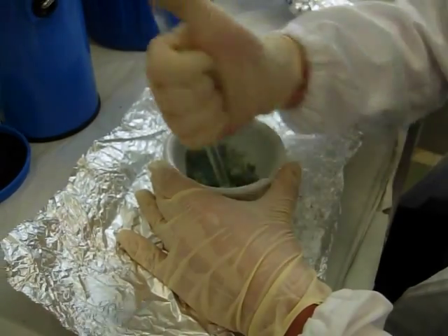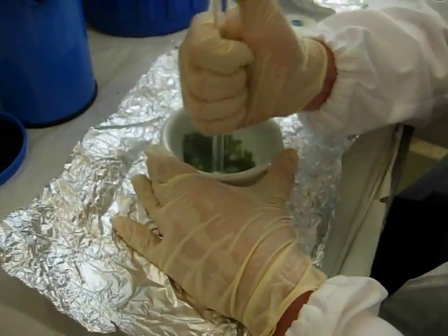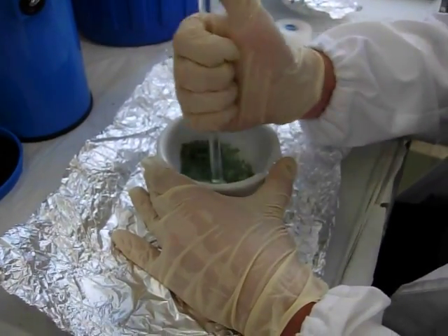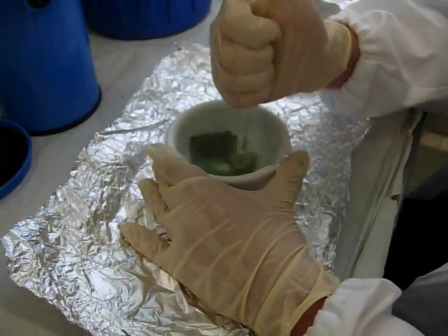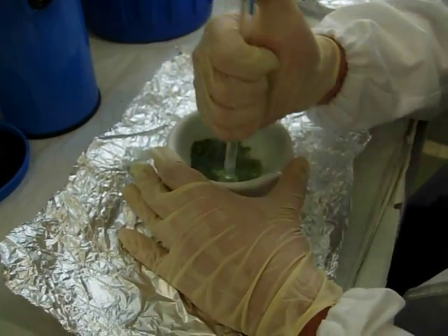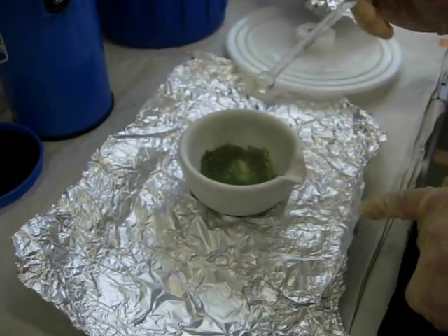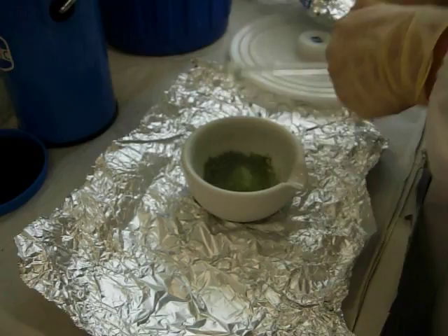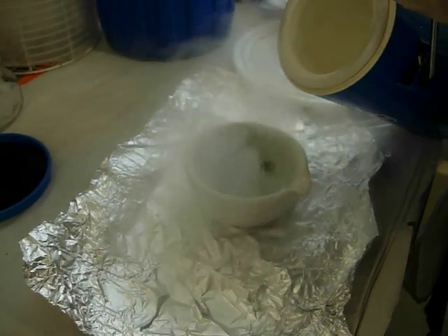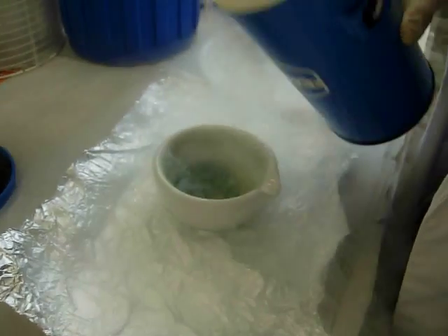The time is the same as for RNA extraction. How long does one extraction take? About 10 minutes after grinding. The full process — like the one we did — was around two to three hours, depending on how many samples you're doing at the same time. I'll add a bit slowly here; there are still big particles remaining.